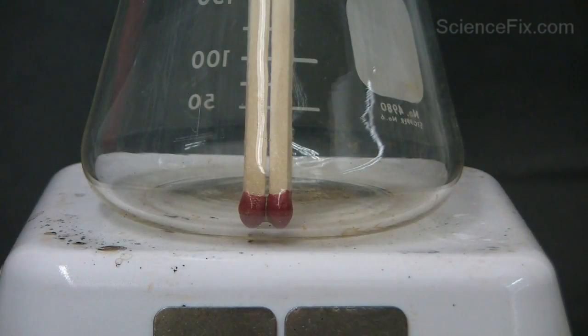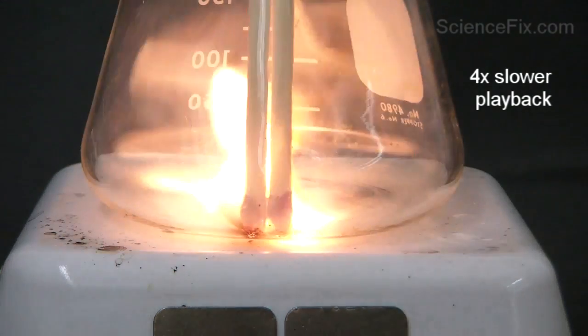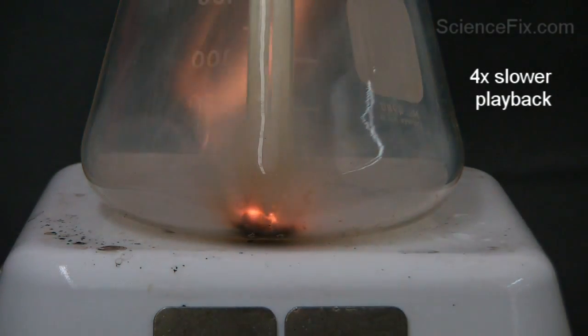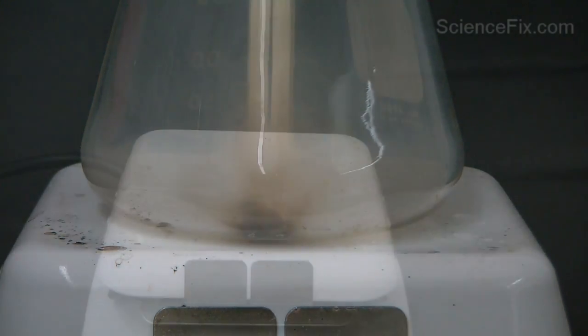Well, in this case, there is no friction. The heat being provided by the hot plate is enough energy to make the red phosphorus react.